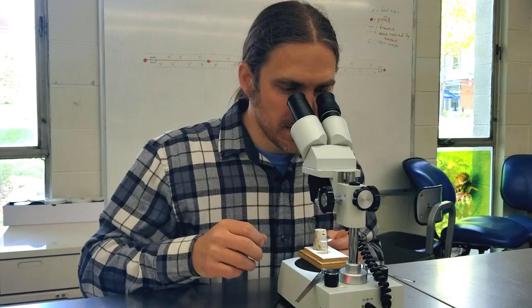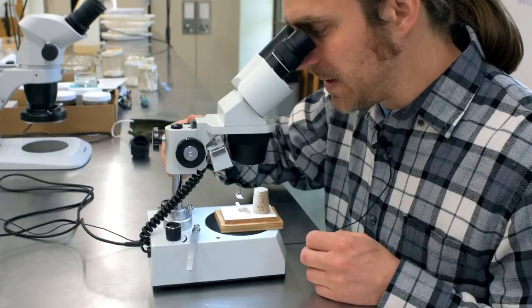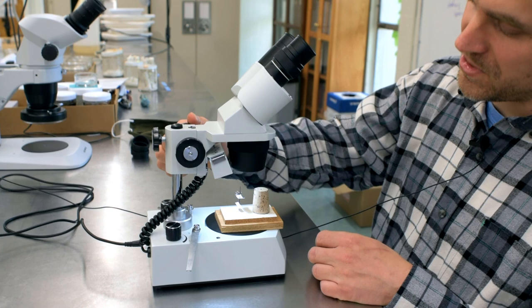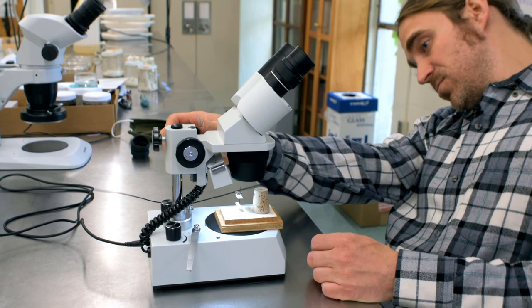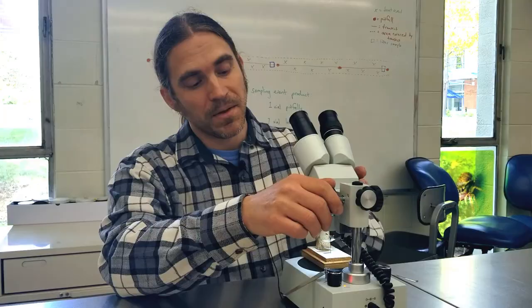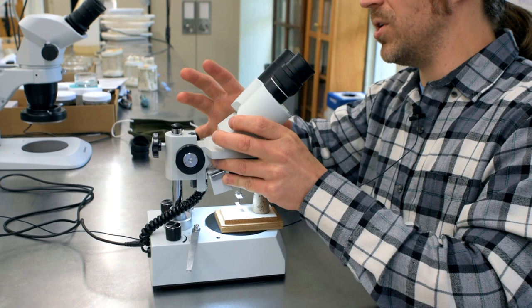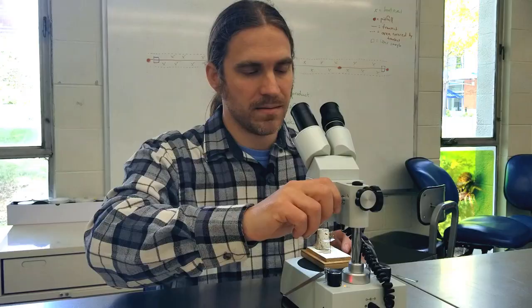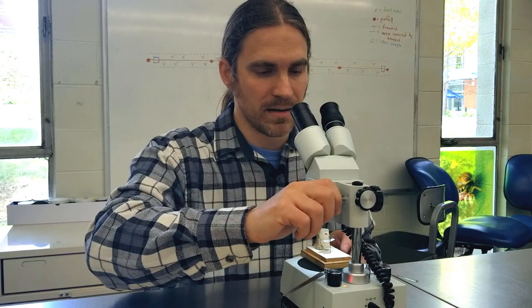If you turn the focus the wrong way, you should be able to tell pretty quickly because things will get out of focus and continue getting worse. Depending on the microscope, you can adjust all the way down until you hit the specimen, which would be bad. When adjusting the coarse focus knob, make sure to hold onto the head of the microscope — if you let it go, it will slam down onto the specimen or the cork block, potentially breaking the insect or the microscope. Turn it slowly one direction; if it's not coming into focus, try the other direction.